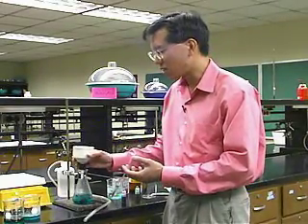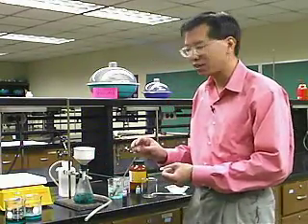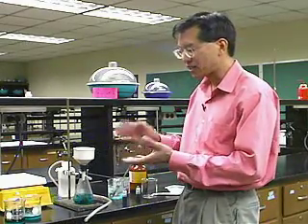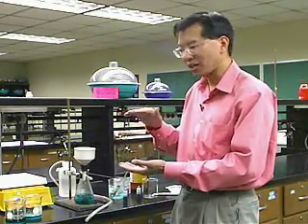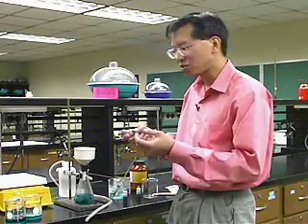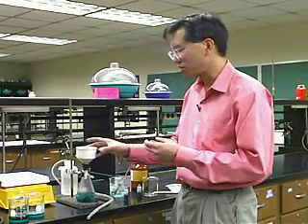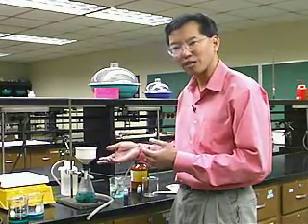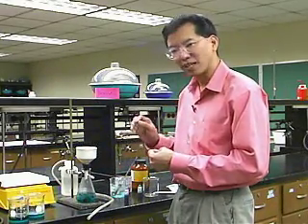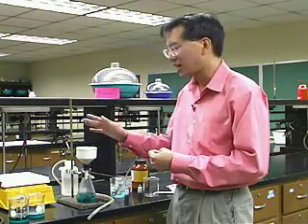So what have we done? I've demonstrated the concept of a crystallization, where you take a product that isn't pure, in this case the impurity was food coloring, and bring it to its solubility limit at high temperature, and then cool it down slowly, and the material will crystallize, and the crystals will be very pure. To collect the crystals, you do a vacuum filtration. You could do a gravity filtration, but it's faster to do a vacuum filtration. And the product, once it's washed with a little bit of cold solvent, is typically very clean and very pure. And that's another technique for effecting the purification of a compound.